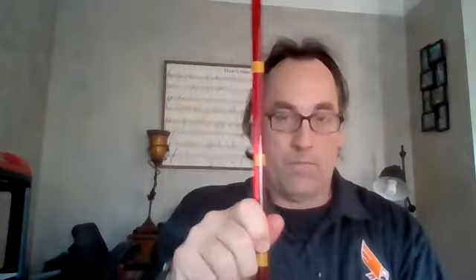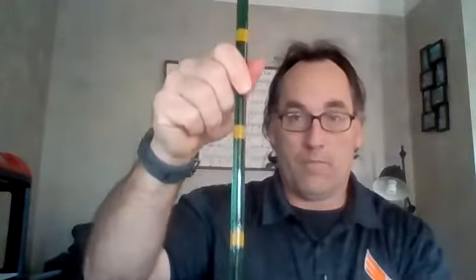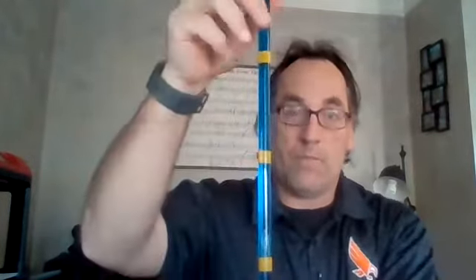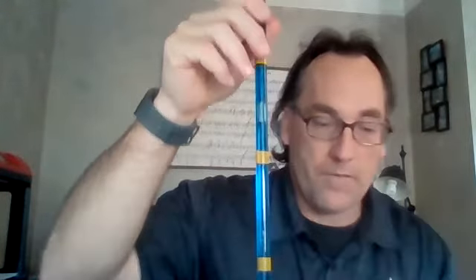Here we go. 3.6. Green at 30. 9.9. Blue at 30. 5.5.